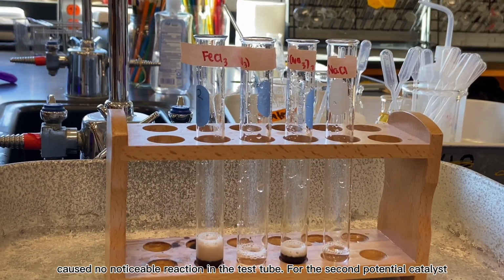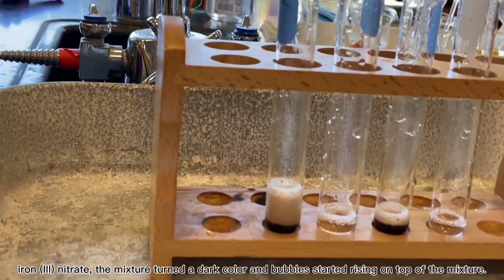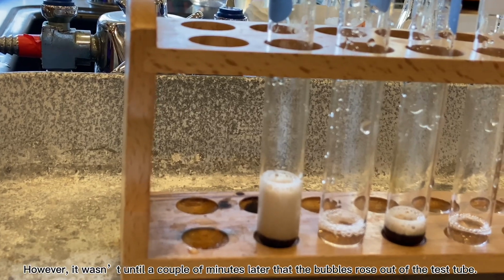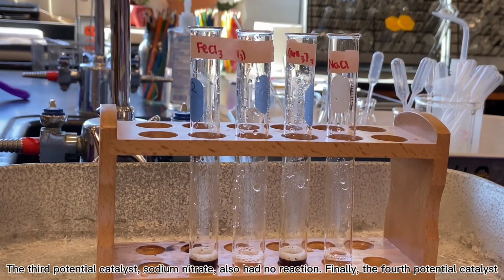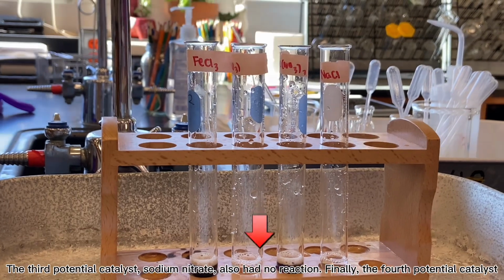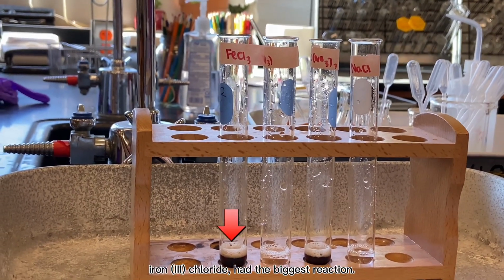For the second potential catalyst, iron 3 nitrate, the mixture turned a dark color and bubbles started rising on top of the mixture. However, it wasn't until a couple of minutes later that the bubbles rose out of the test tube. The third potential catalyst, sodium nitrate, also had no reaction. Finally, the fourth potential catalyst, iron 3 chloride, had the biggest reaction.